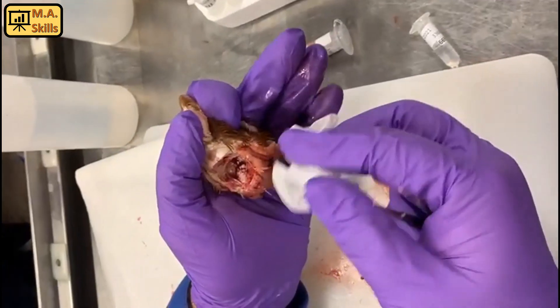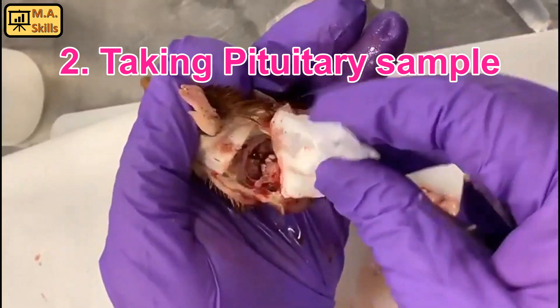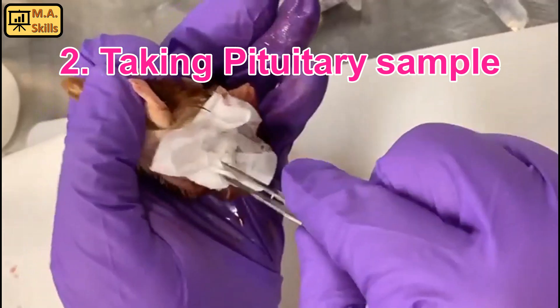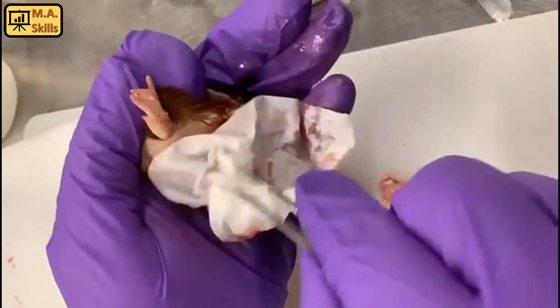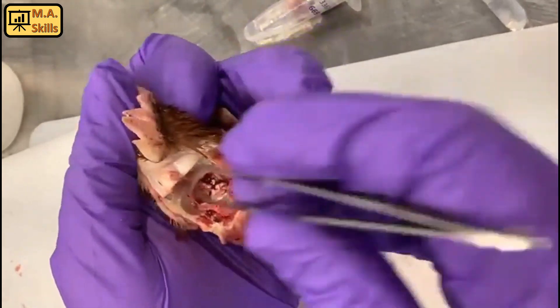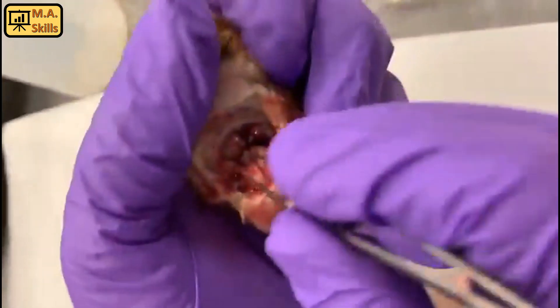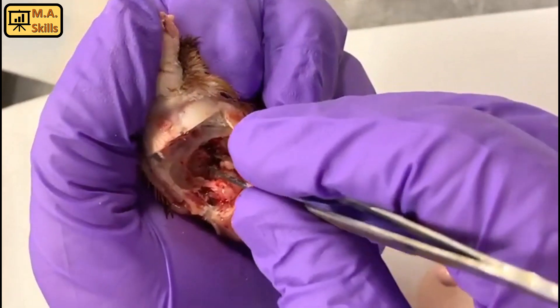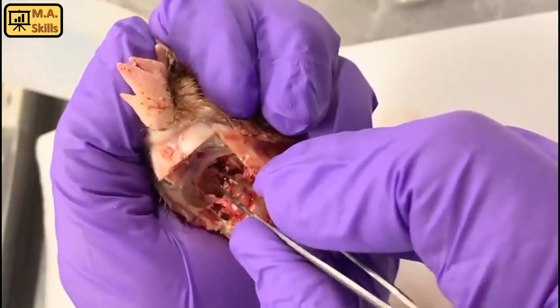Now we're going to take the sample. What I'm doing is just cleaning the bone area over there. The pituitary is located just underneath this bone.